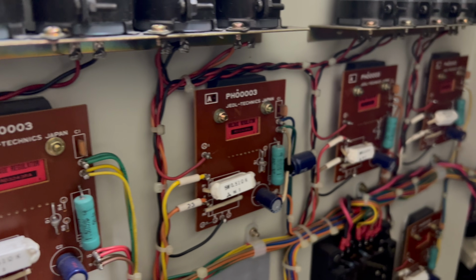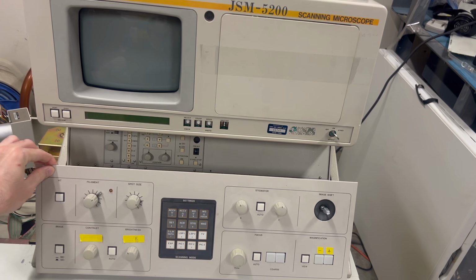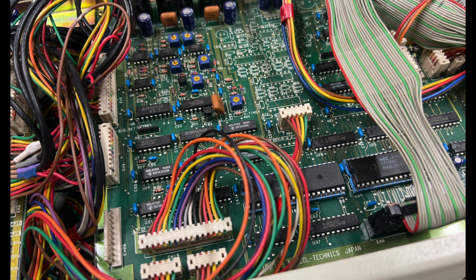Next, we have a bunch of different power supplies, including one that goes up to 25,000 volts. This is the accelerating voltage that creates the electron beam. After that, we have a bunch of sensitive analog circuitry. This is a bunch of amplifiers and stuff that carefully control the current to the electromagnetic lenses that deflect and focus the electron beam. They are also responsible for magnifying the minute electrical signals that are produced by the detector.